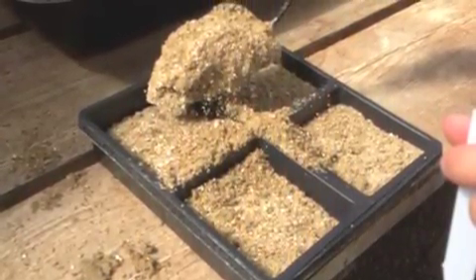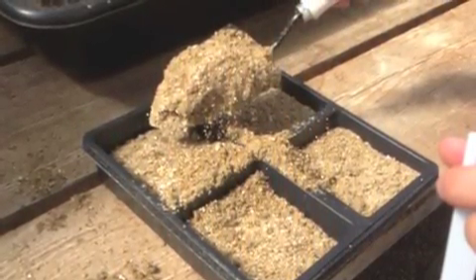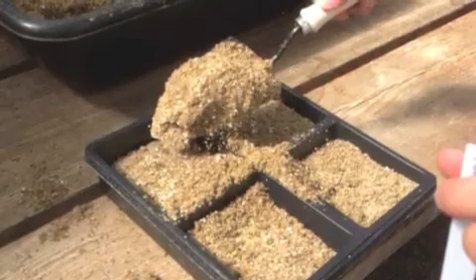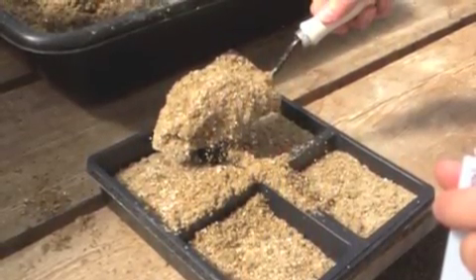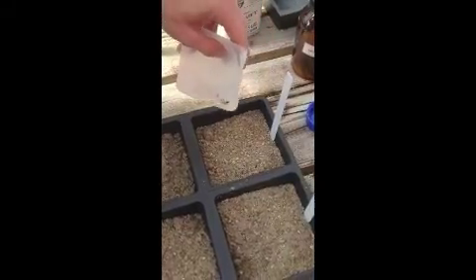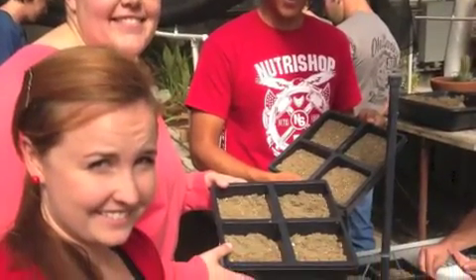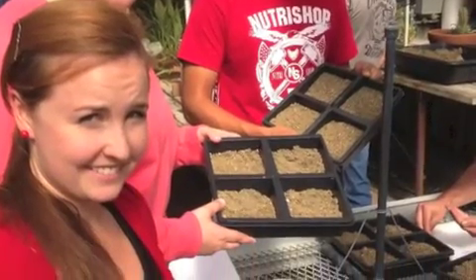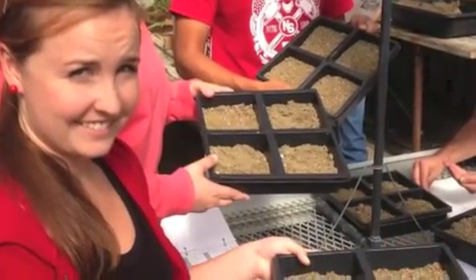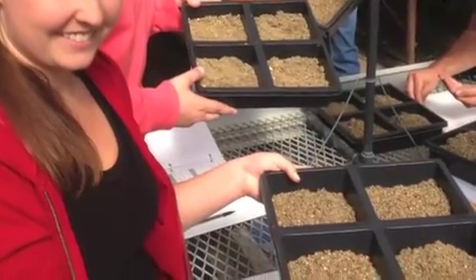Procedures were as follows. 16 different planting plots were filled with sand vermiculite mix, separating the plots into groups of 4. 1 gram of 0-10-10 fertilizer was applied to each plot. Ammonium nitrate was applied to each tray as follows: 0 grams to 1 pot, 0.25 grams to 1 pot, 0.5 grams to 1 pot, 1 gram to 1 pot.